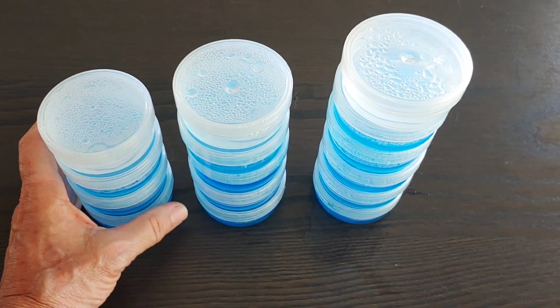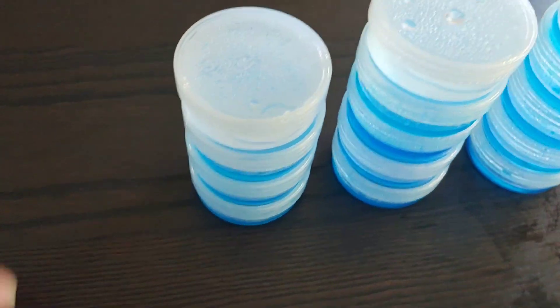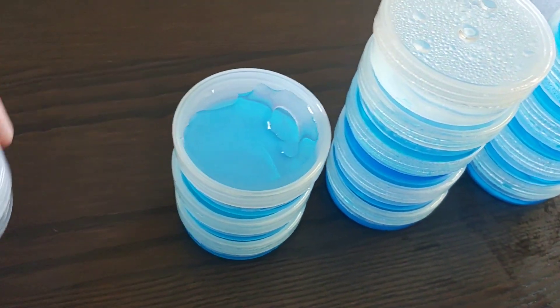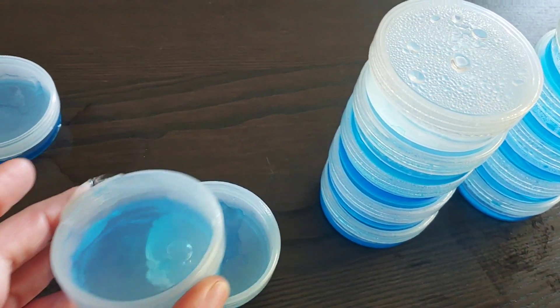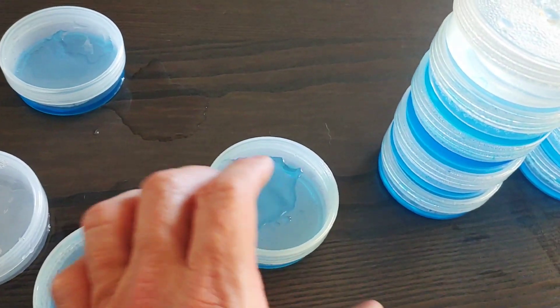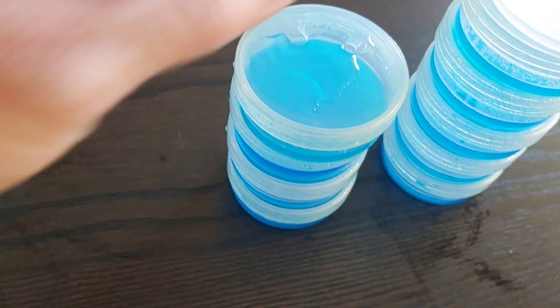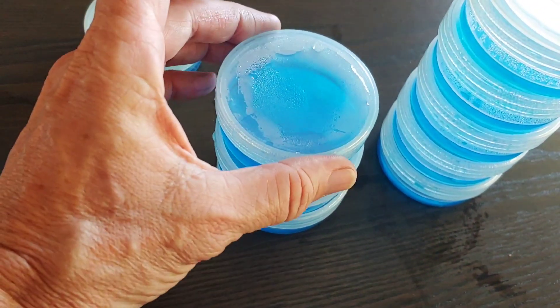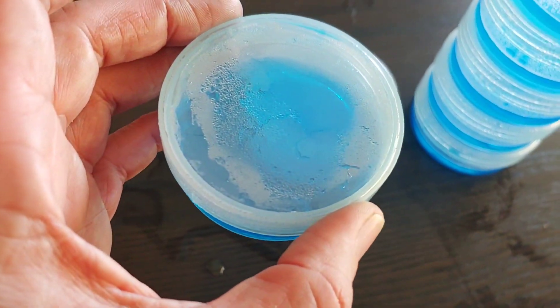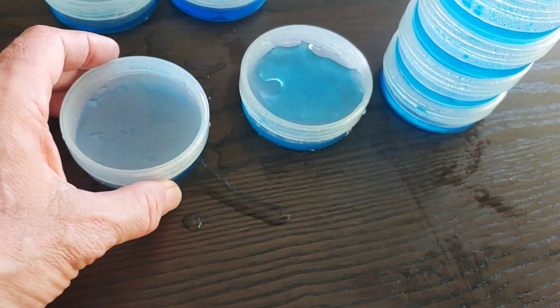It's been about half an hour and they are cool to the touch, so let's start checking. See the water I added? That's it — that's the solution. Now let's see, that's three. This one's got four. This one, for some reason, still has some condensation, but the others don't.